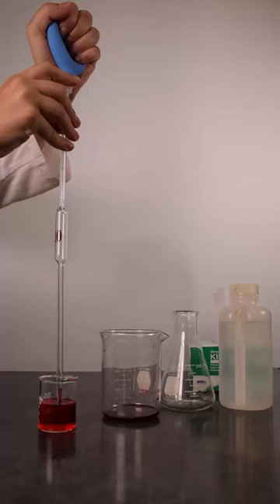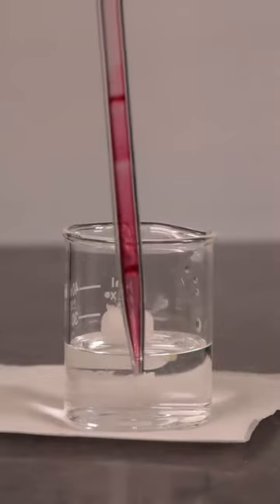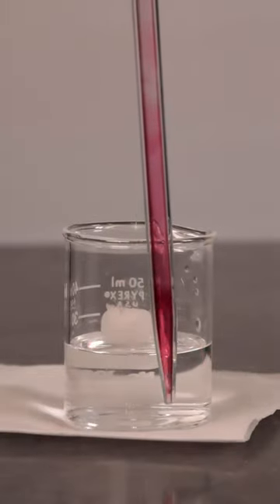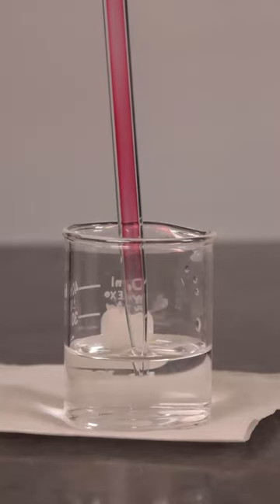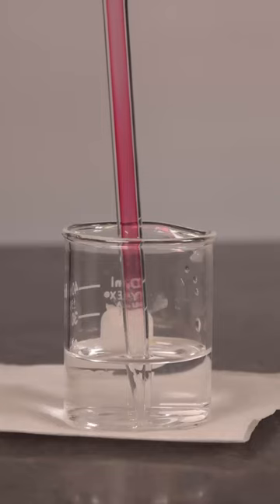This is done so that any small amount of liquid in the pipette tip does not fall into and contaminate the solution. Notice in this example how air is drawn into the pipette before being placed into the rinsing water. Using this technique, none of the dye contaminates the rinsing water.